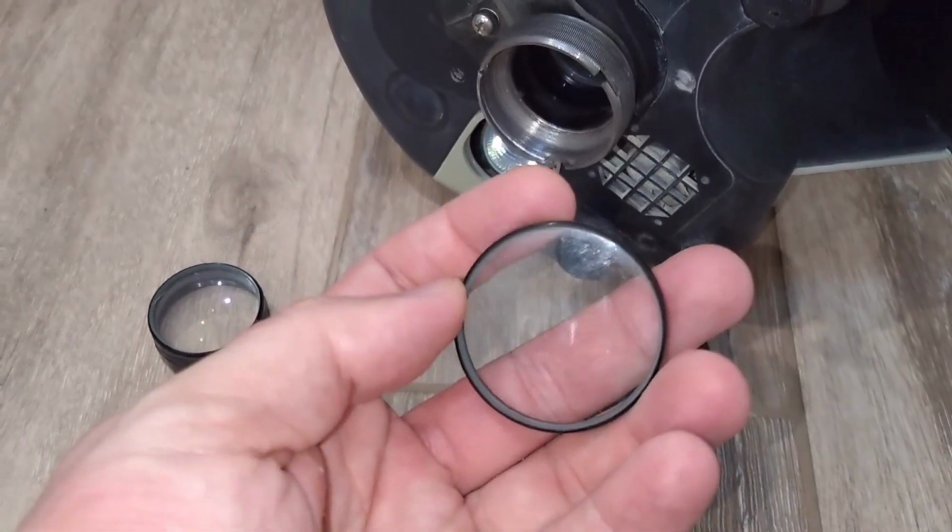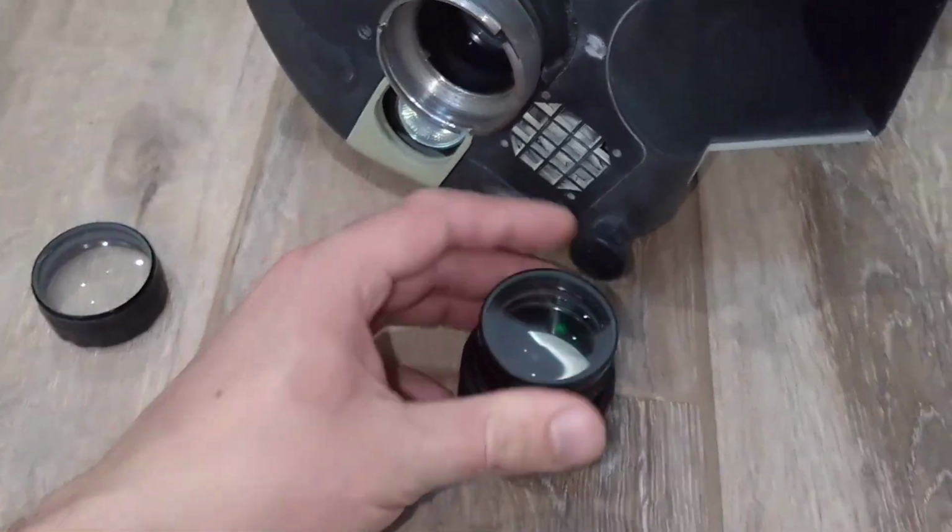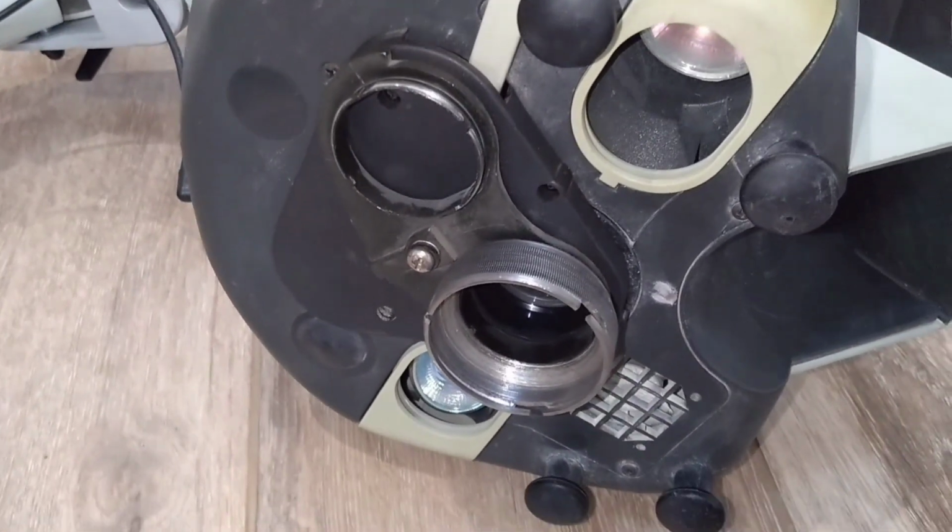I am repairing such a microscope for the first time. I have no idea what is inside, so please do not judge too harshly.